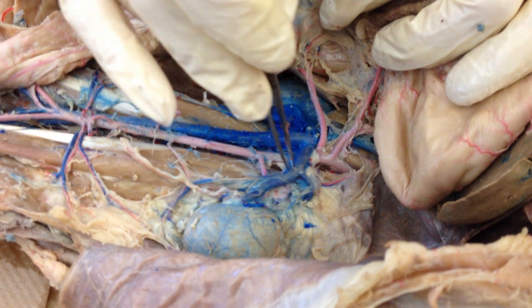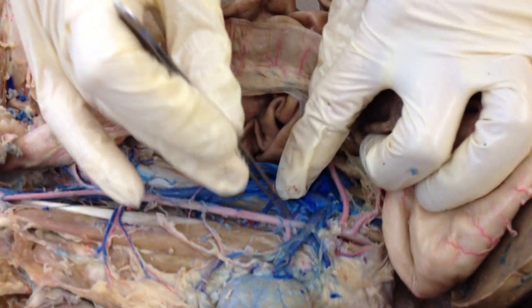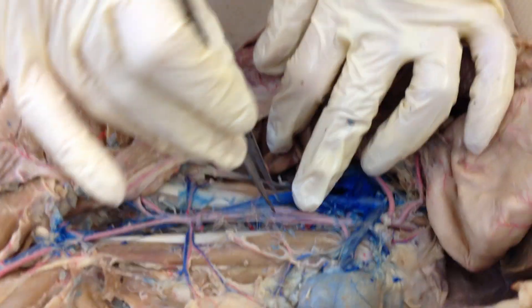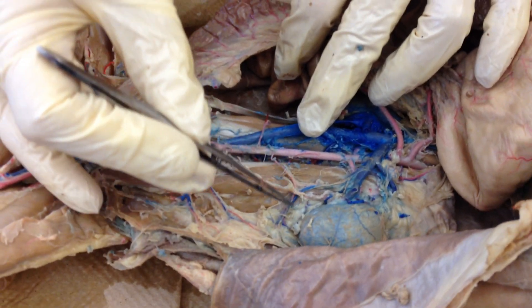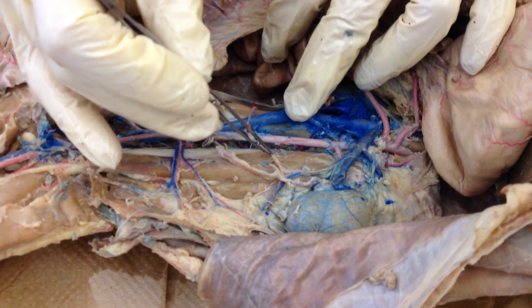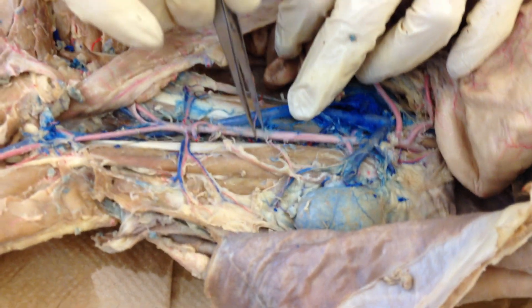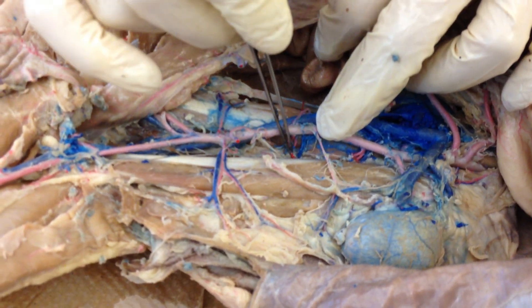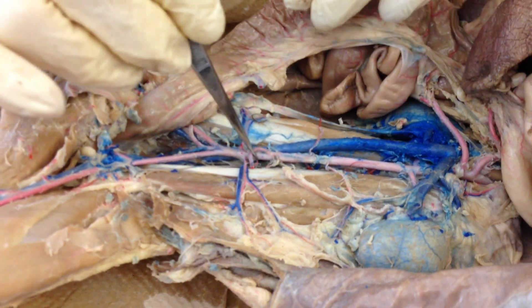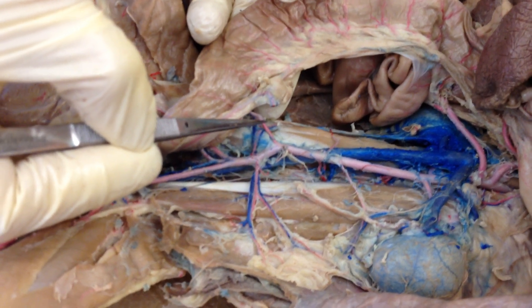Moving on down, we can see the aorta branching into the renal artery on each side. Then going on down — this is a male — this branch is the testicular artery, coming around and going down to the scrotum. If this were a female, it would go straight out to the ovary and come off the aorta there. You can also see the lumbar artery and a lumbar vein going straight down into the back, coming off the aorta. Continuing down, this artery is the inferior mesenteric, and it feeds the lower large intestine.